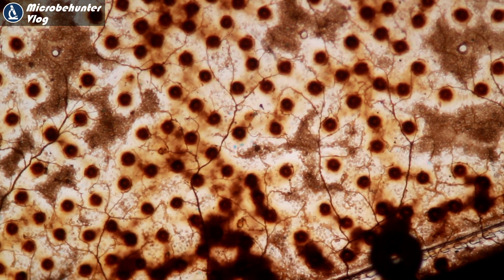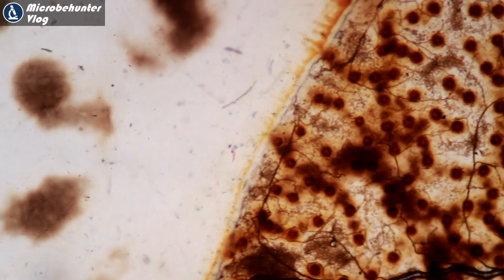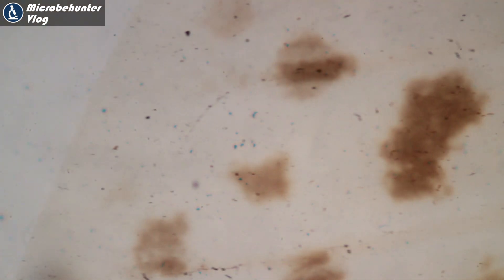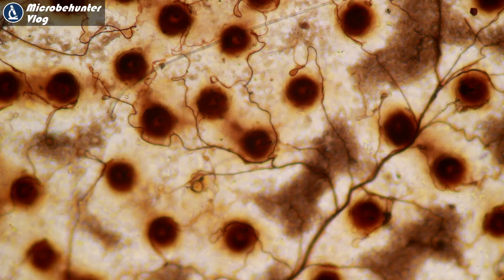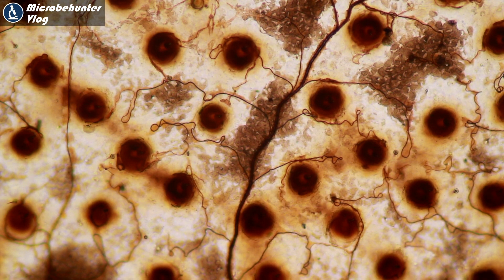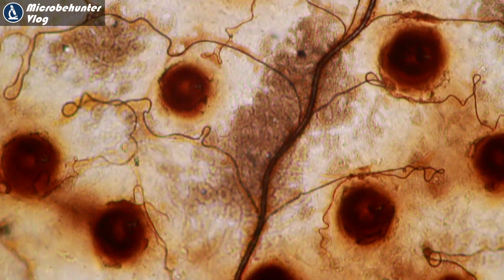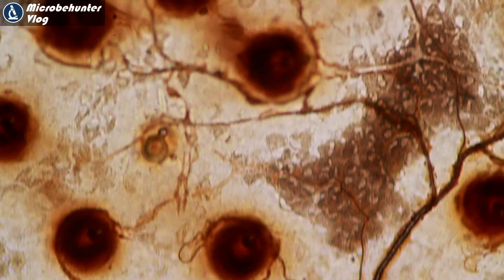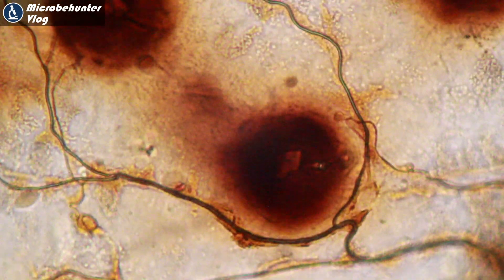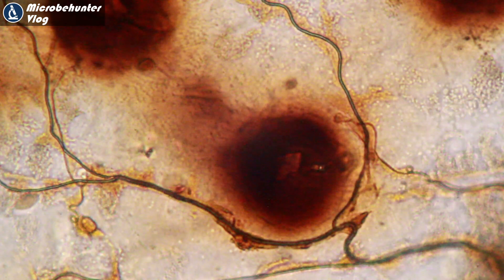Here is how it looks: this is the hard part of the first pair of wings with the nice little dots. Zooming in, you can also see what appear to be blood vessels — branching, river-like structures. Moving over to the non-transparent part you can see dark brown pigmented spots. At higher magnification the blood vessels become clearer — they branch out, transporting nutrients through the wing. This is important because the wing itself is a living structure that needs nutrients; there are living cells in there. Here, zoomed in deeper, you can see the dark spots surrounded by the branching blood vessel network.